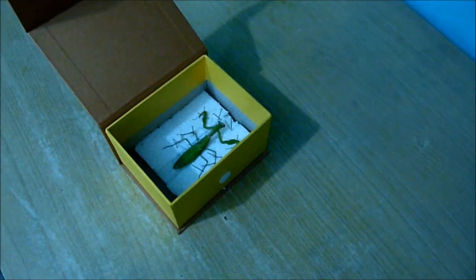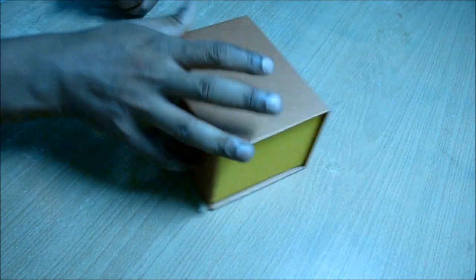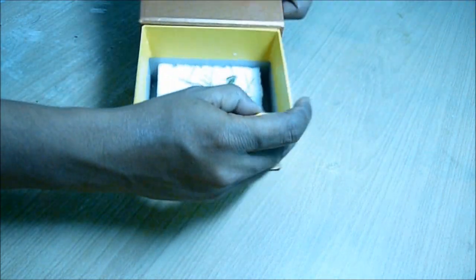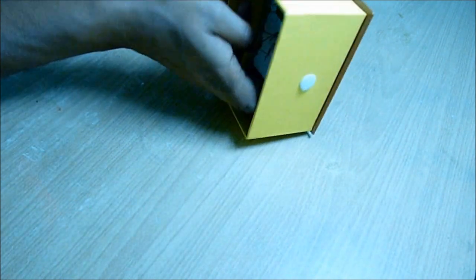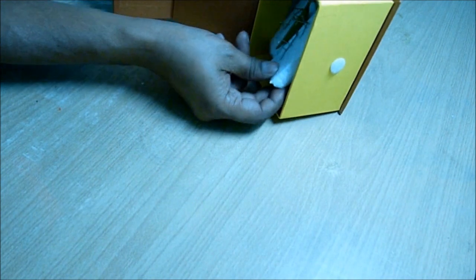This is how the full insect was pinned. Then I kept it inside a box and kept it for around two days to dry it up. After two days we opened it. You can see here this insect is fully dried.